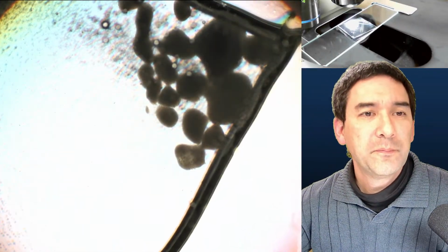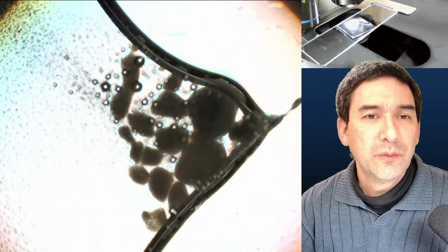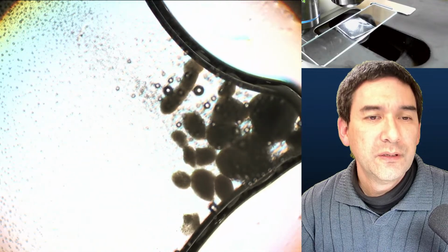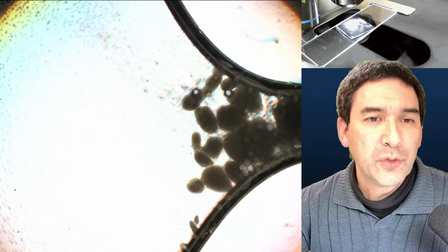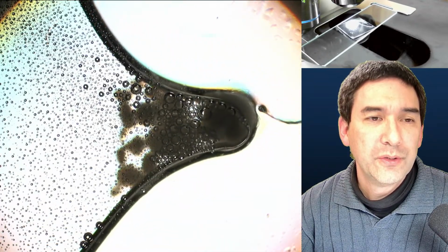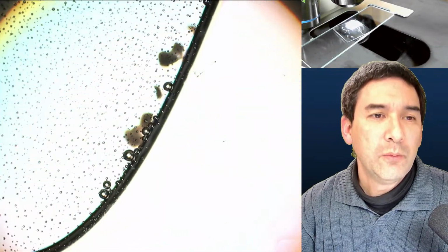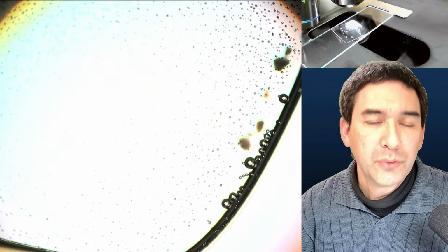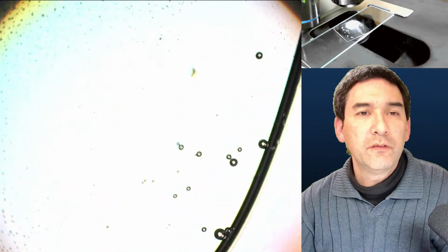Go down a little bit with the magnification here so that you see. Yeah, because of capillary action, of course, the water is also moving. And as the crystals become smaller, of course, the film of water between the cover glass and the microscope slide, of course, also, yeah, lots of bubbles. See, and pretty much almost everything's already gone. There's so many bubbles. I almost think that this is not just trapped gas, but it probably is to a certain extent also carbon dioxide. Yeah. So that's kind of how the dissolving process looks like.